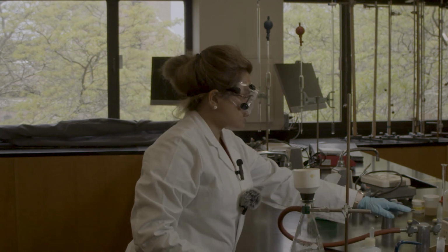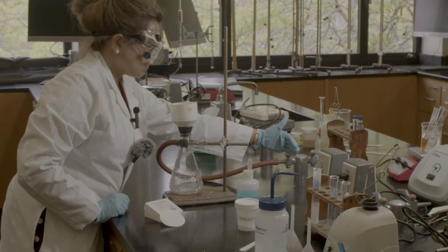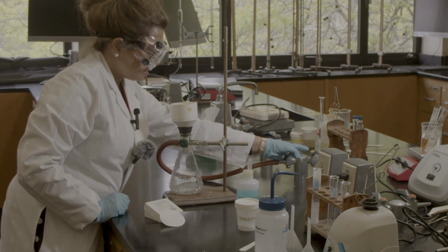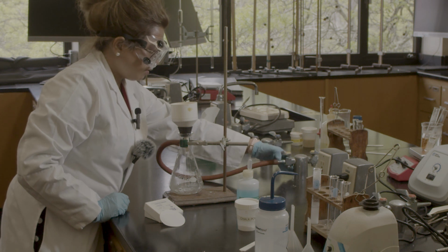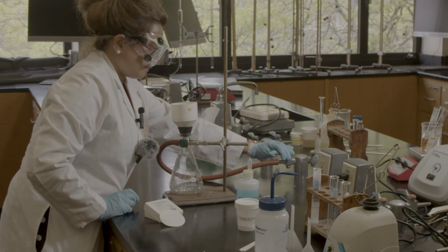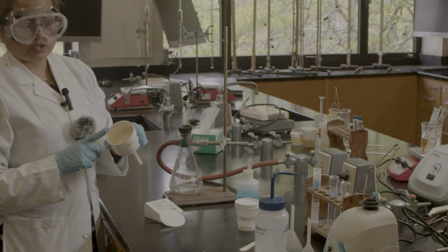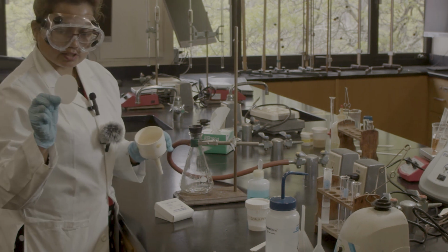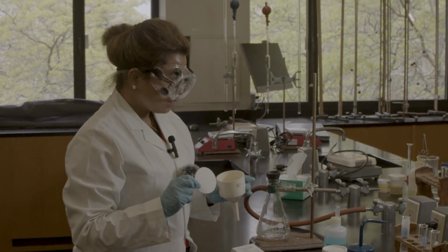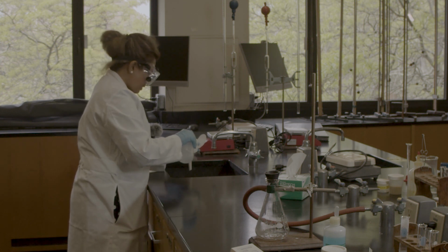How can we do the filtration? This is the vacuum valve. The horizontal way is closed. If you want to open it, it should be the vertical way, all the way to here, so I can hear the hiss. This is the funnel we are going to use for filtration, and this is the filter paper. Before you use the filter paper in this funnel, we have to use a small amount of water so that my filter paper sticks.